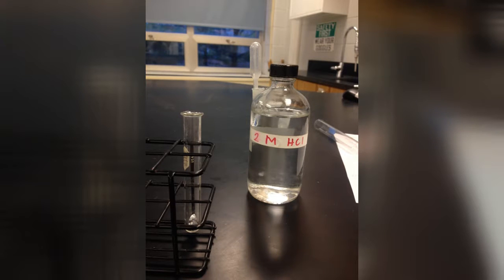Here we have another chemical reaction from the Chemical Reaction Type 1 section, where mossy zinc metal is going to react with 2 molar hydrogen chloride, and while it's going to react, we're going to be doing a wood splint test, which is lighting a wood stick on fire and then placing the ignited section into the mouth of the test tube to see what type of gaseous product is made. And so in the following video, you're going to see or hear that reaction.